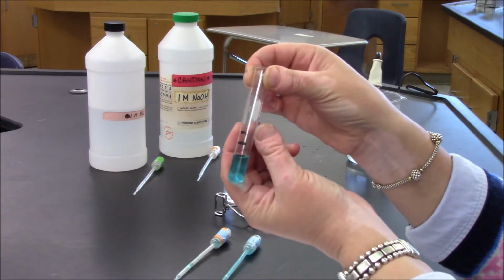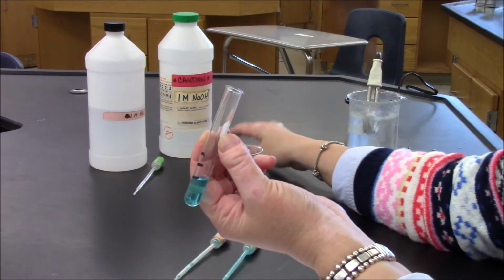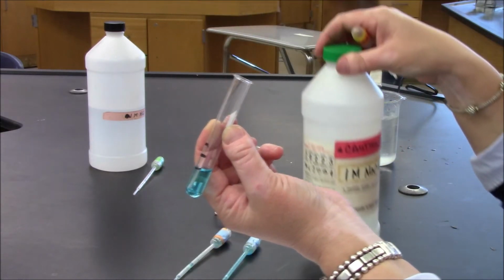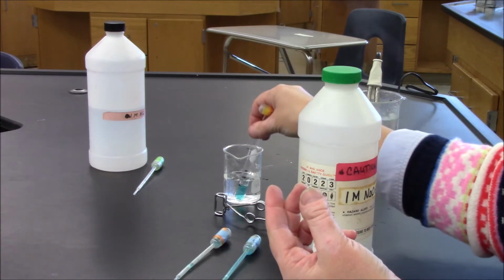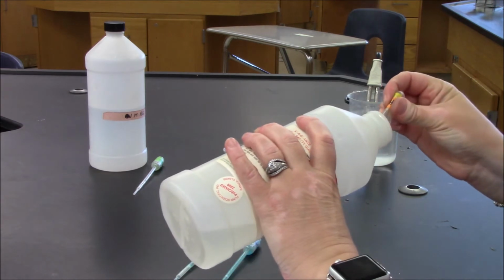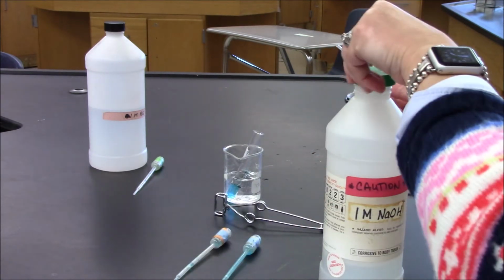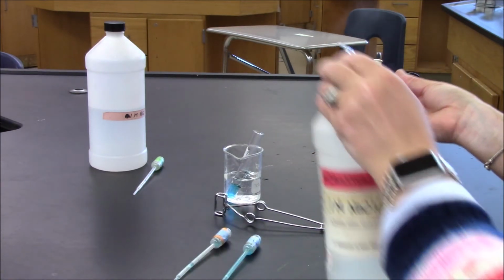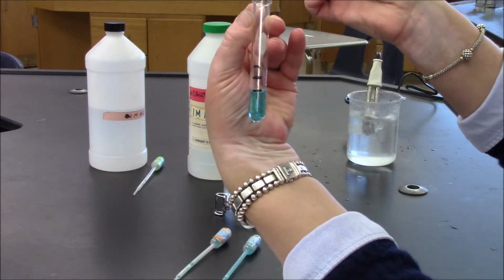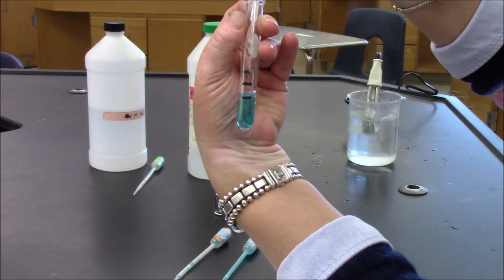The first change that I will observe is a change that happens when I mix a second substance with it, sodium hydroxide. And I don't think I have enough, which is why I brought my bottle. So I'm going to place down my test tube. And I'm going to get some more. Test tube again, and I'm going to add sodium hydroxide up to the first line.